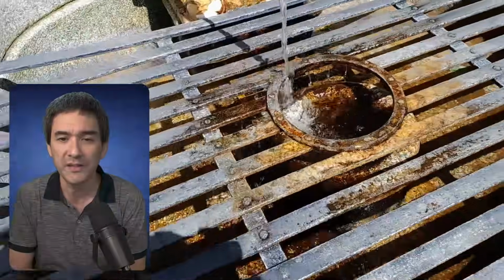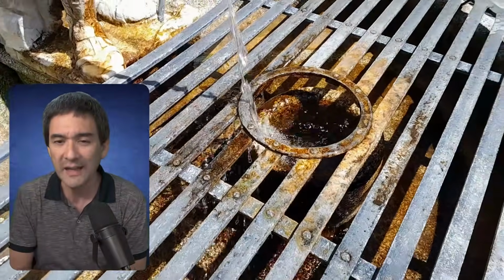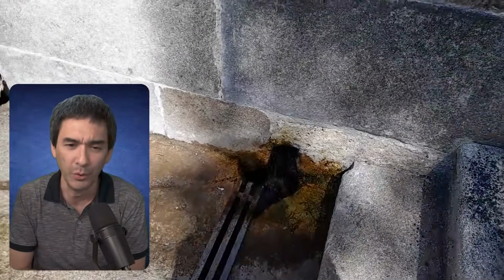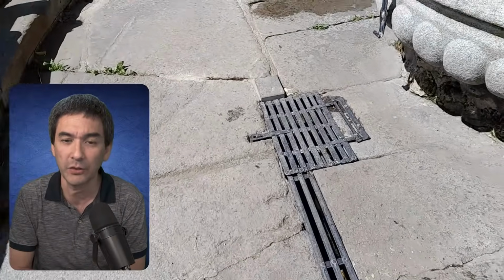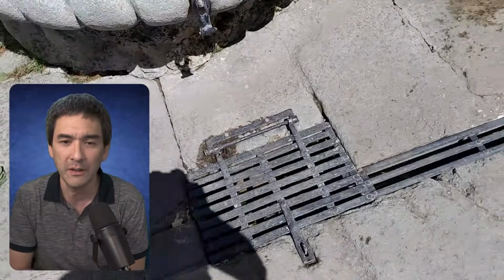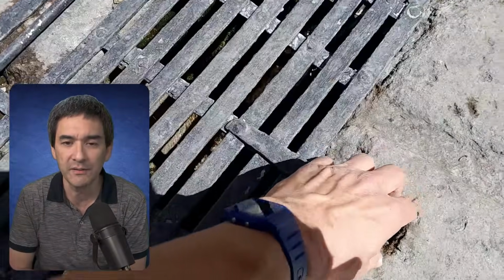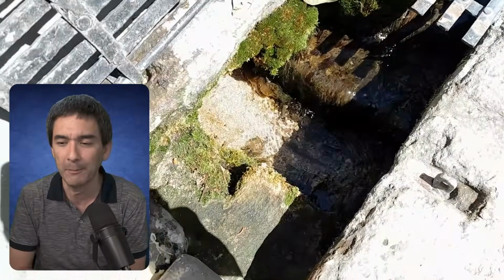You see, a couple of years ago when I visited this place, it was overgrown with moss and algae. I found, I don't know, water fleas there, even like a pond. But nowadays it's really clean, so I was really frustrated at the beginning, because I thought, oh my gosh, I don't know what to show you during the live stream. And then I said, okay, maybe there is something in here. So I lifted up this thing here, and indeed this was the place where I was able to collect a small sample.